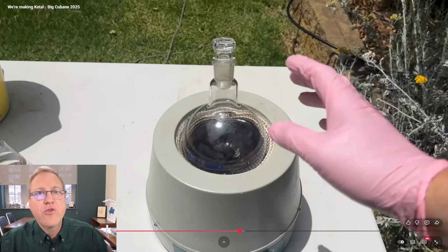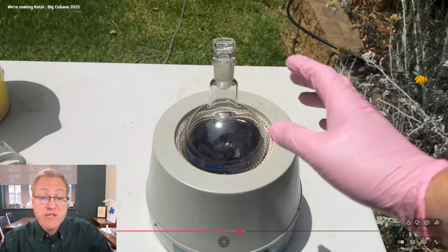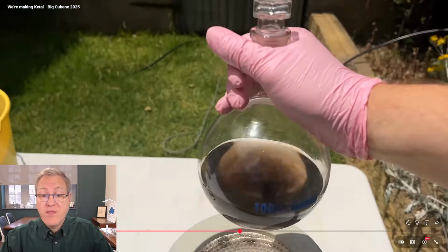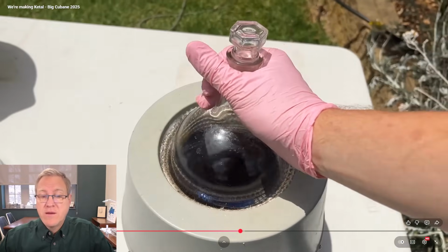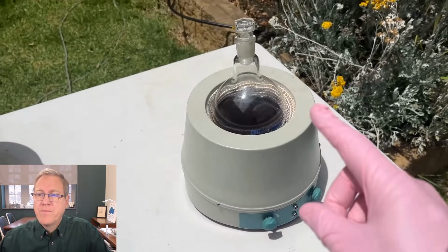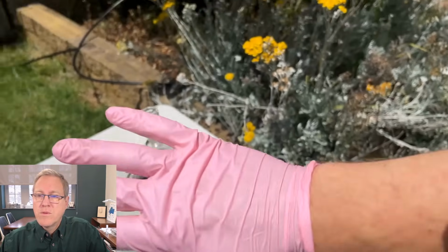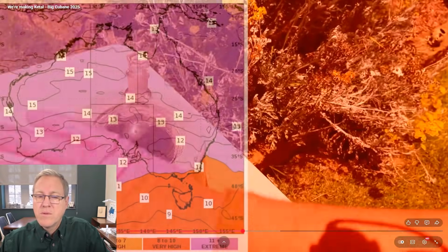All right, I edited a little clip out because he was finishing up his previous reaction making the cyclopentanone. Now he's coming back to this refluxing toluene sulfuric acid mixture. And I think we can turn on the volume again. Now, concerns that the toluene would tar up if we just added sulfuric acid and refluxed it. If it was like kind of technical grade sulfuric acid, oh my God, I can feel my skin literally on fire. It is.